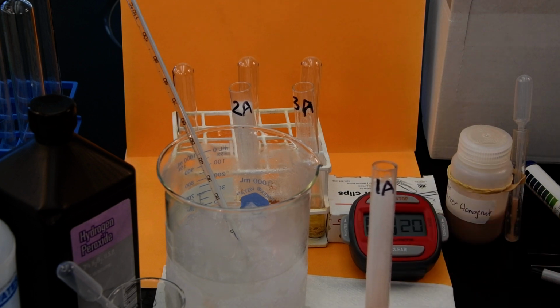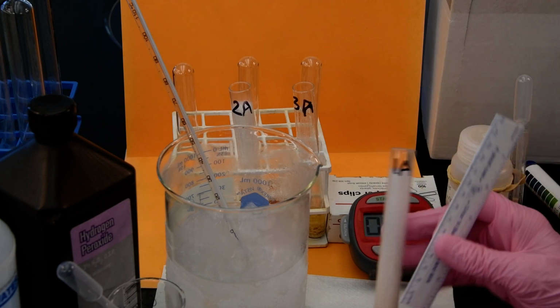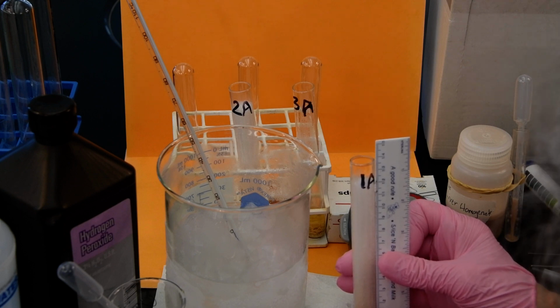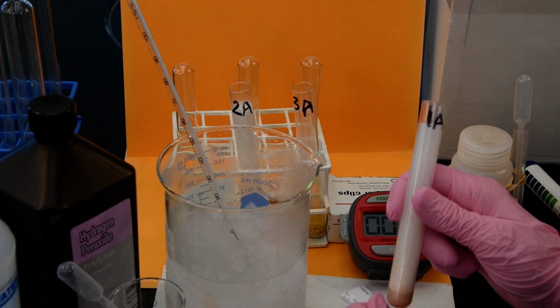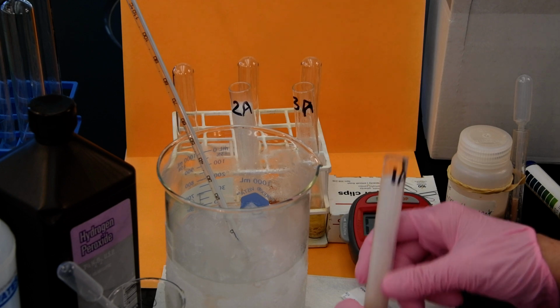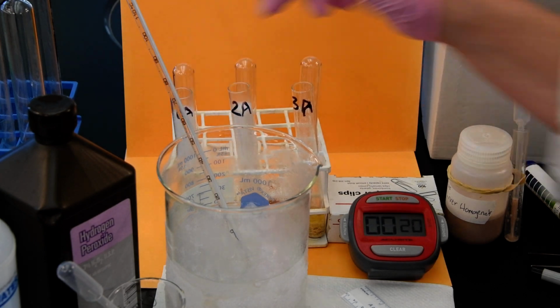Now, after 20 seconds, whoops, metric, okay, we see that we're at about 12. So there's a difference between this and 2A, but you notice, again, it reacted very quickly. It really didn't slow down. So this does beg the question, what effect does cold have?